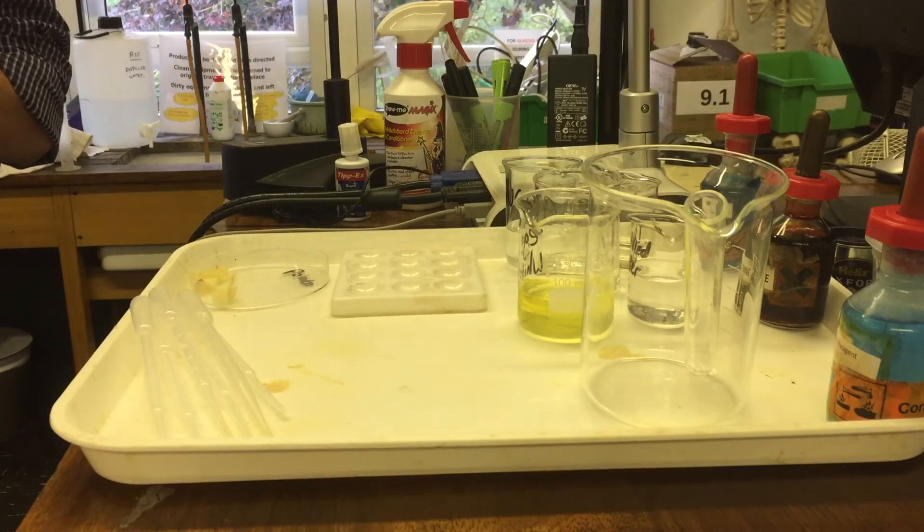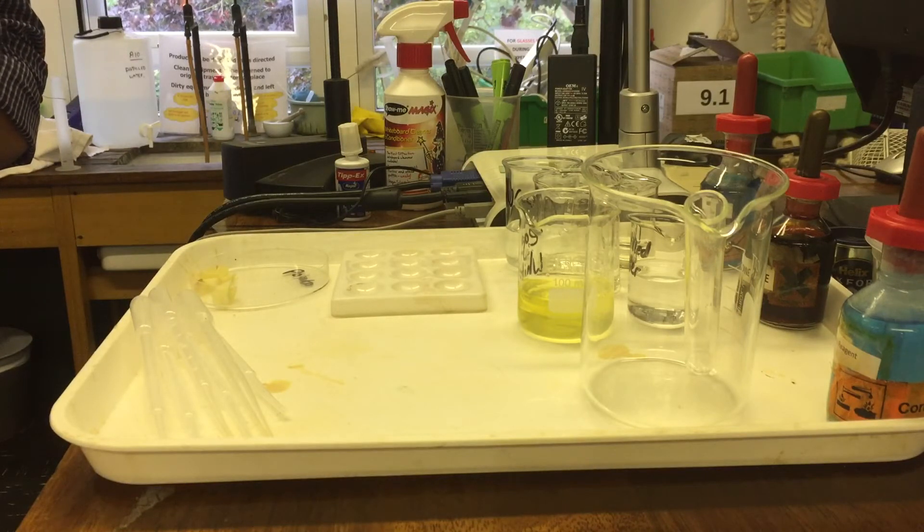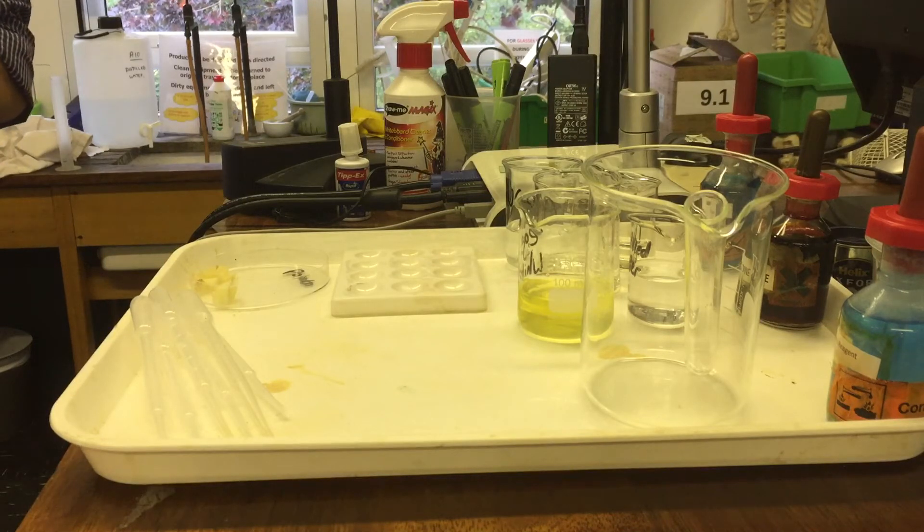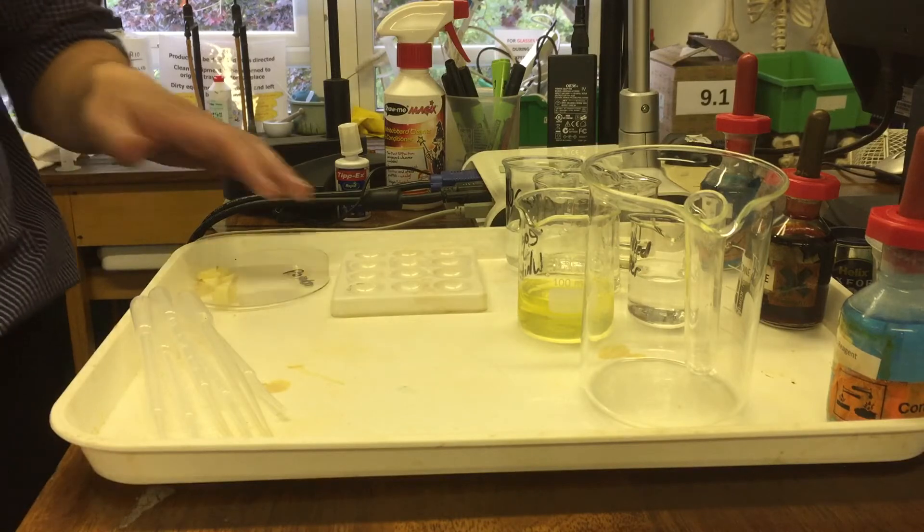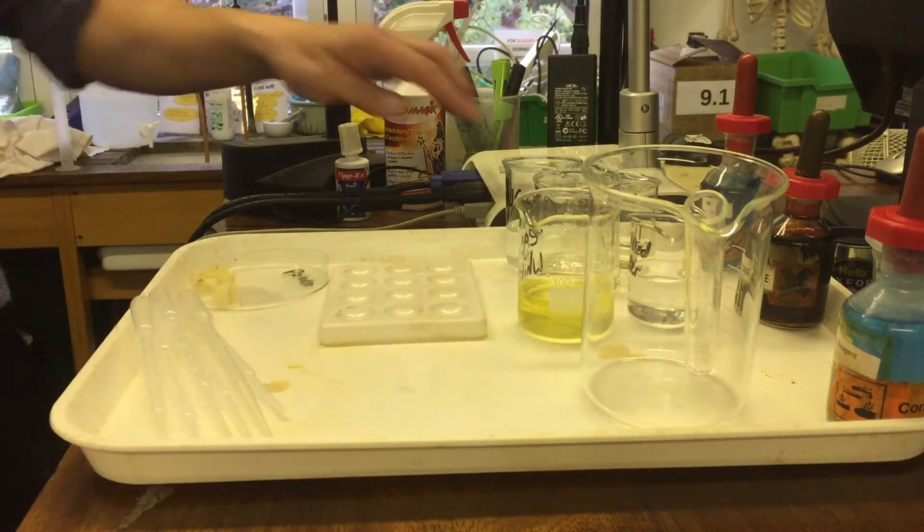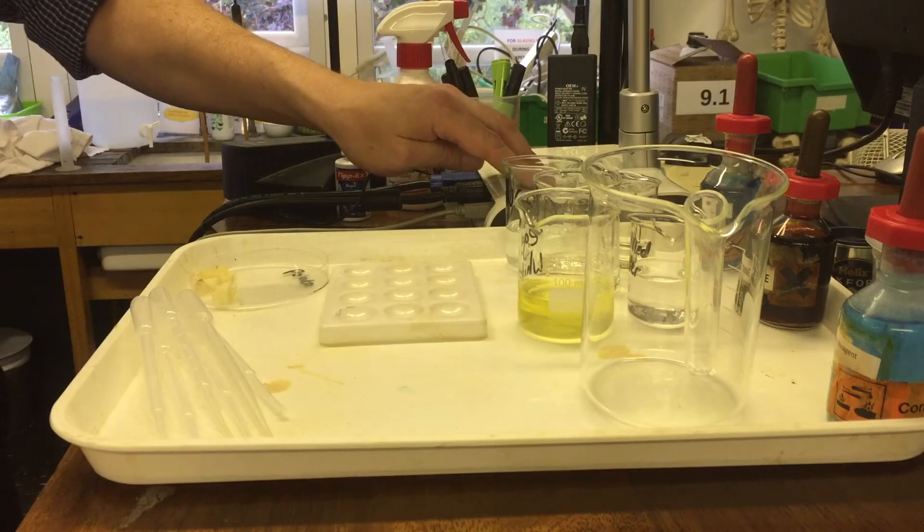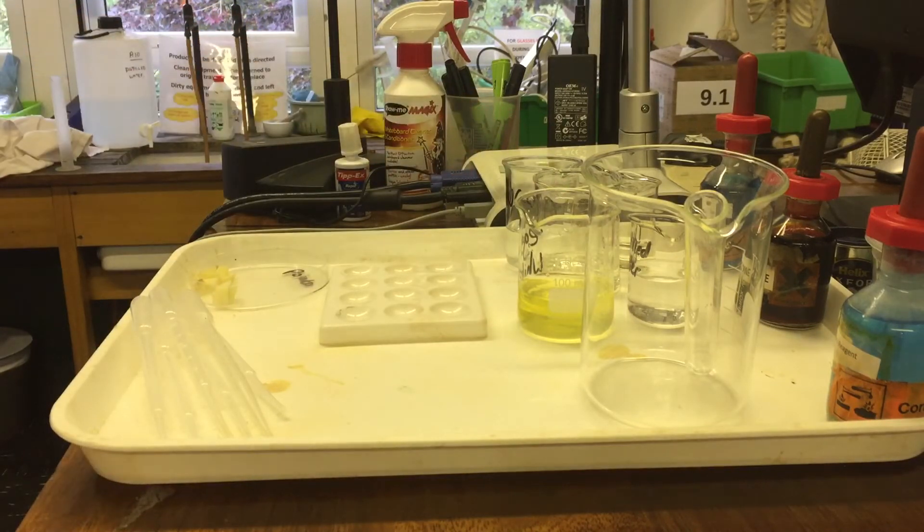Whereas if you have a Mars bar, Mars bar is just full of simple carbohydrates, simple sugars that don't have to be digested. So just to show you the difference between that, we've got our well plate here and I'm going to just project that up for you to see onto the projector.